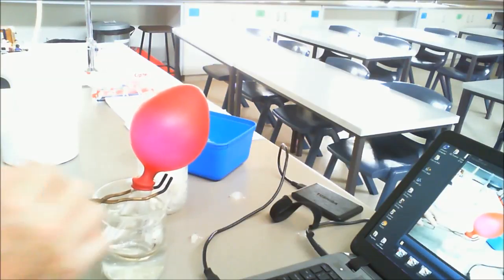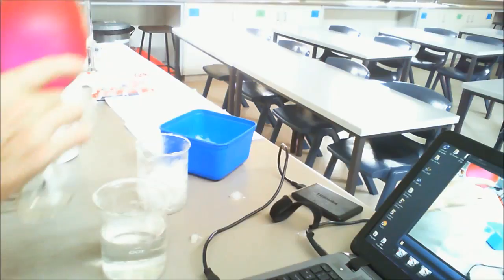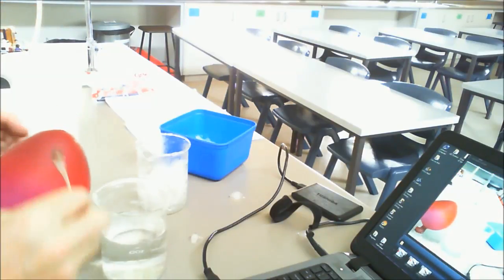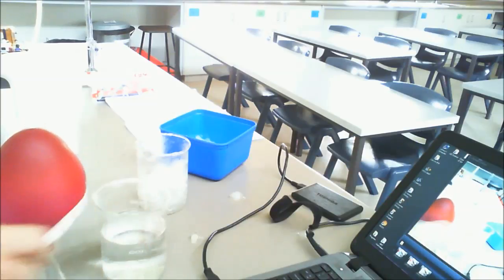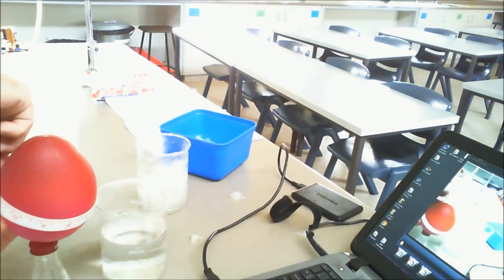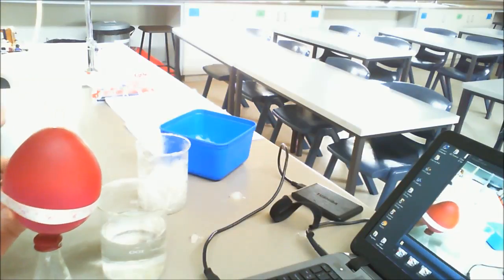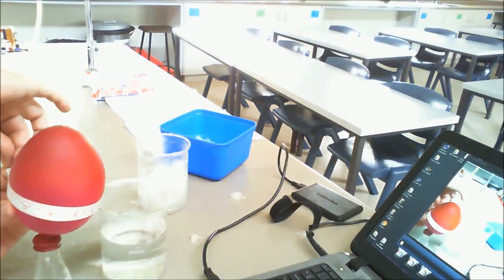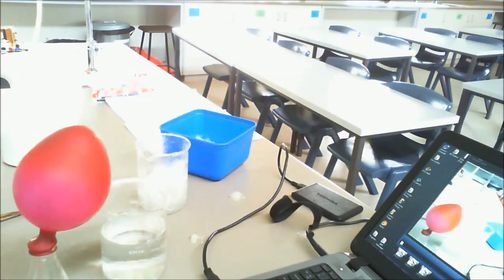Okay, that's been about 5 minutes, so I'll take that out now and re-measure the balloon, this time after the hot water. I can see it appears to be a little bit larger. It'd be interesting to see how much it is. And we get up to 33, no, it's still right around the bottom, 32.5 centimeters. So it has increased from the original room temperature of 30 up to 32.5.